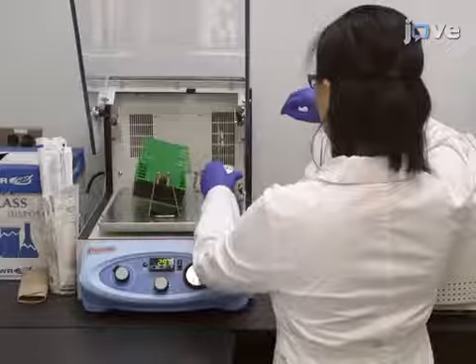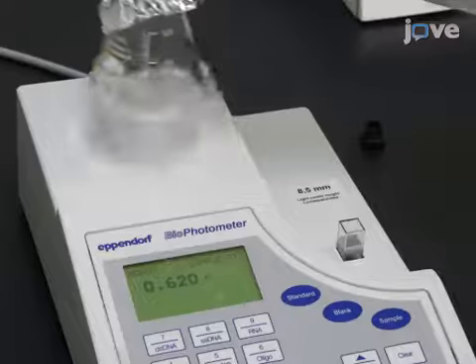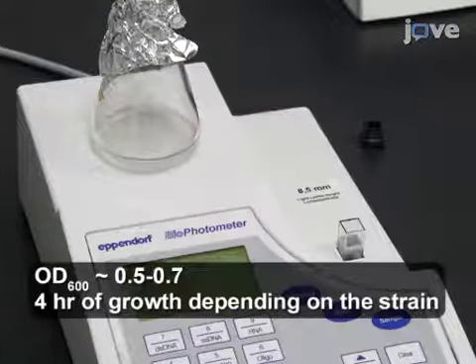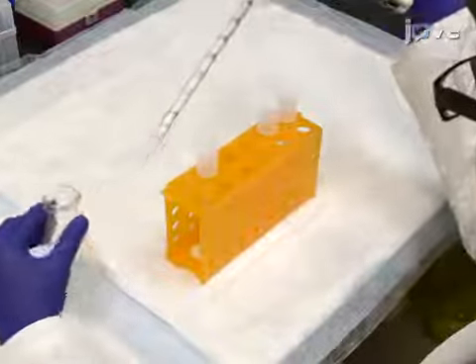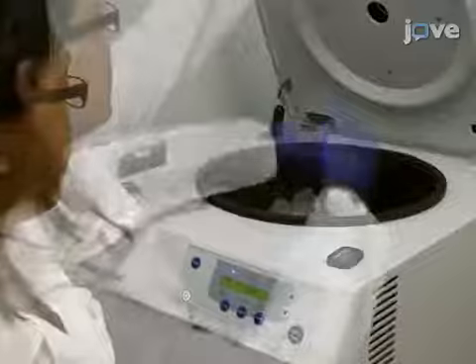To begin, grow a 20 milliliter liquid culture of the yeast strain SEY6210 in complete synthetic medium at 30 degrees Celsius with constant shaking to mid-log phase. Next, transfer a total of 10 to 14 OD of the yeast cells to a 12 milliliter round-bottom centrifuge tube and centrifuge at 800 times G for 5 minutes.